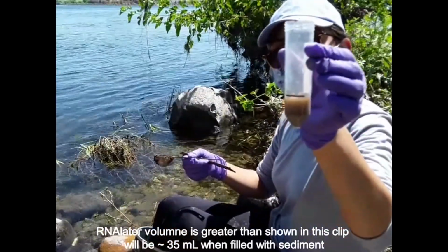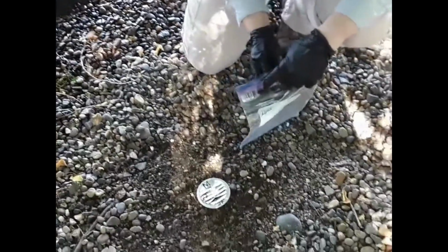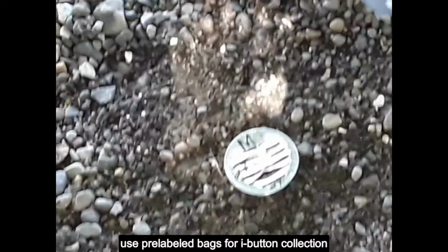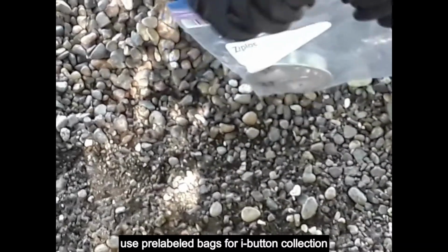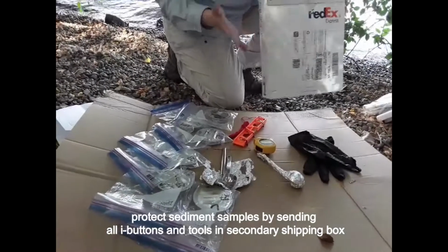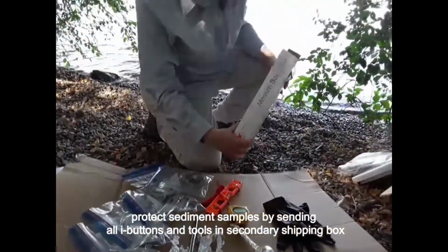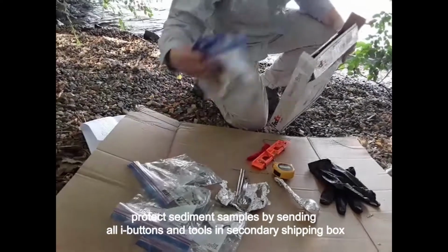After collecting sediments, collect all the I-buttons. Please do not remove I-buttons from their housings or modify them in any way. Simply place each I-button with its housing in the appropriate Ziploc bag. When you're ready to ship, prepare to package the items into 2 boxes. If you have your original I-button box, please use it for the I-buttons. If you do not, please use any box you have available. You can pick one up for free at FedEx.